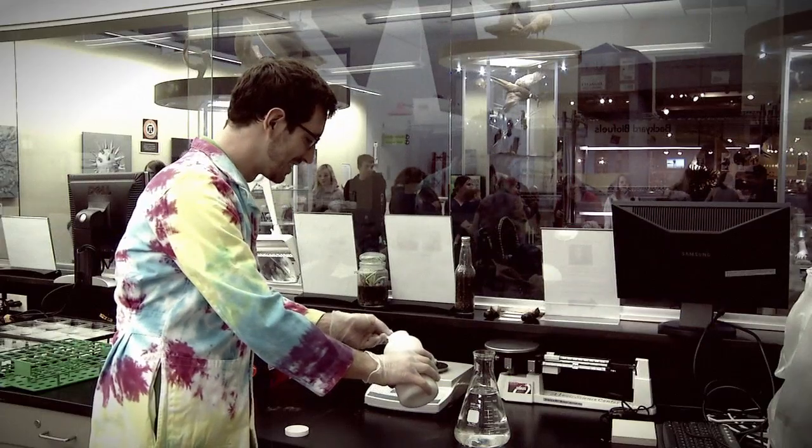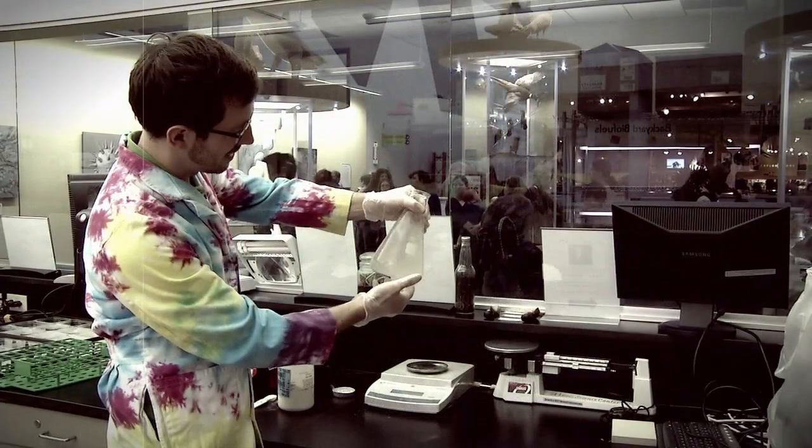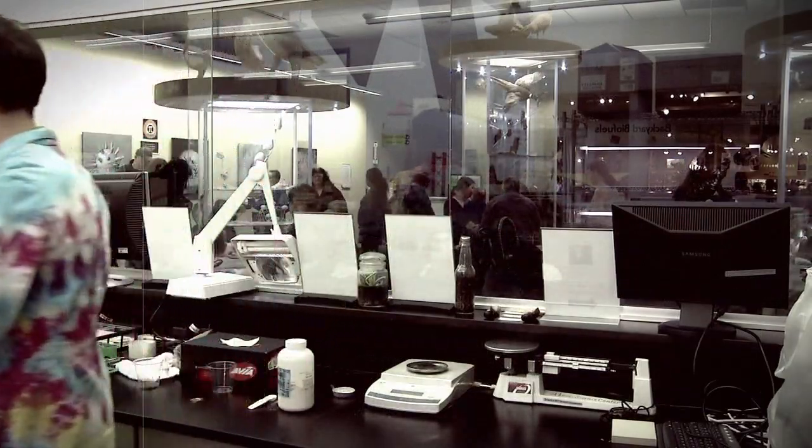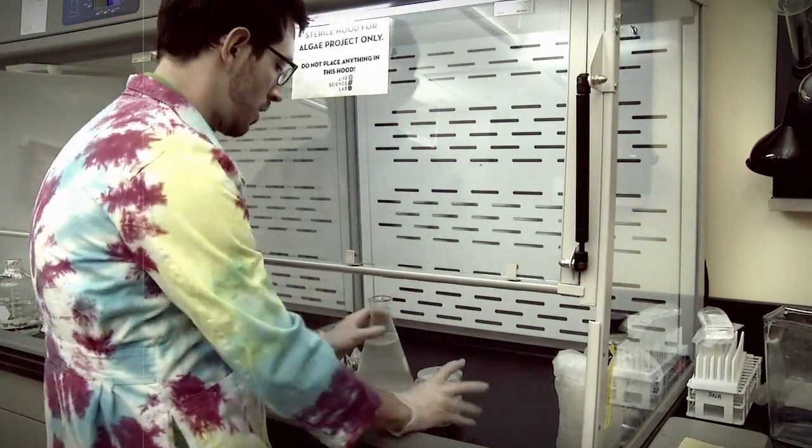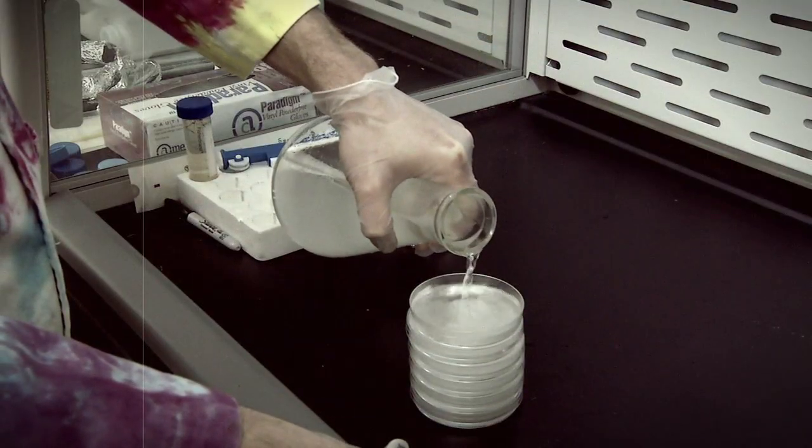Earlier, a plate had been prepared to transfer the algae sample to. To create this, a gel-like substance called agar media has been put into each plate. This substance mimics a freshwater environment which makes the algae comfortable and encourages them to multiply.